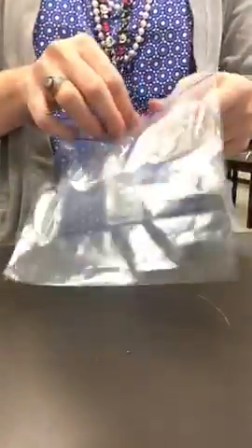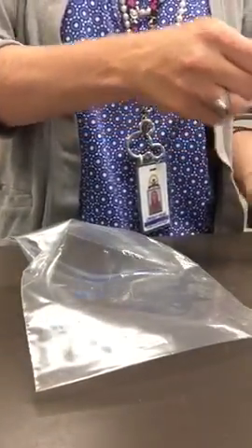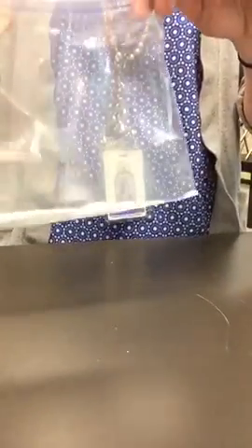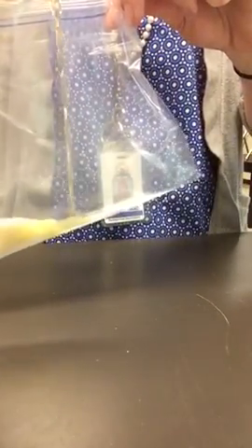So now our next one. Sample 1. Sample 3. See that fizzing? What does that bubbling mean? It's bubbling up. Every time I move, I get more bubbles. That is an example and evidence that a chemical change has occurred. And again, that was samples 1 and 3.